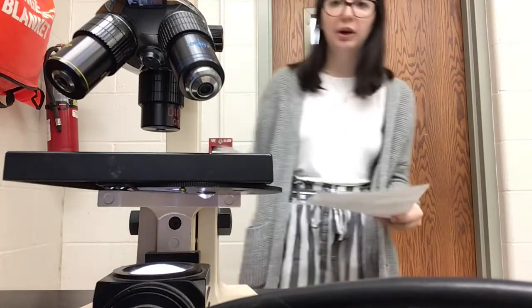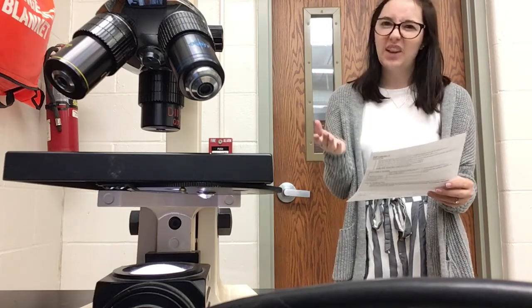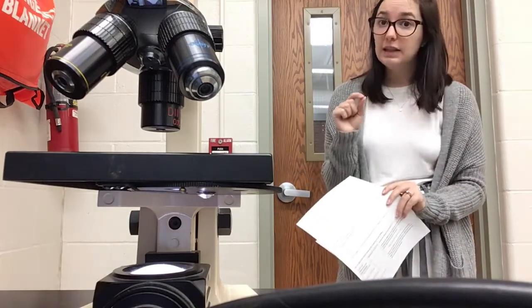I will show you how I prepare a slide, how I put it on my microscope, and how I was focusing it. But your job is, I will show you the copper 2 sulfate, what that looks like, and you'll make some descriptive observations. And then I'll show you what it looks like under the microscope. It might be really difficult to tell, but what you should notice, at least in the first 3, is a good crystalline structure, and then we'll compare that with our mystery molecular compound. So let's prepare the slides and look at the granules, and let's make our observations.